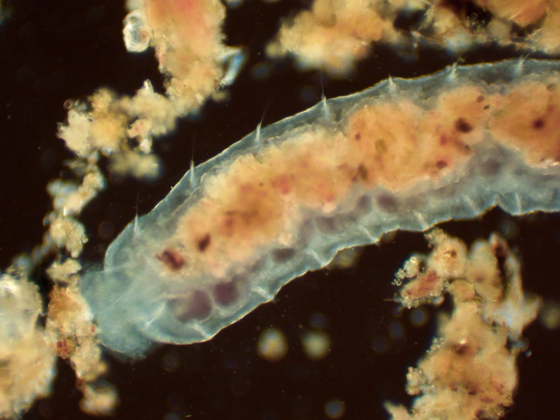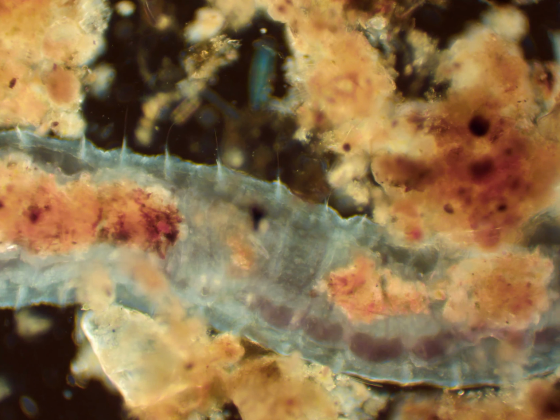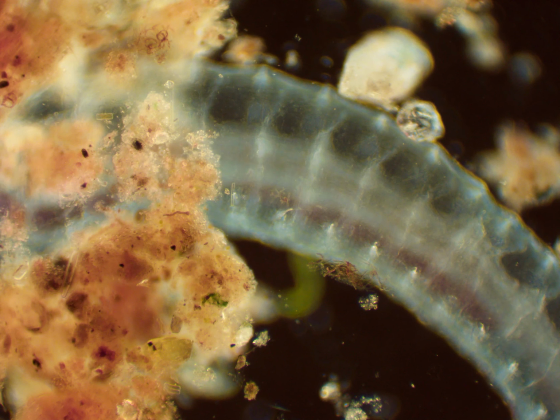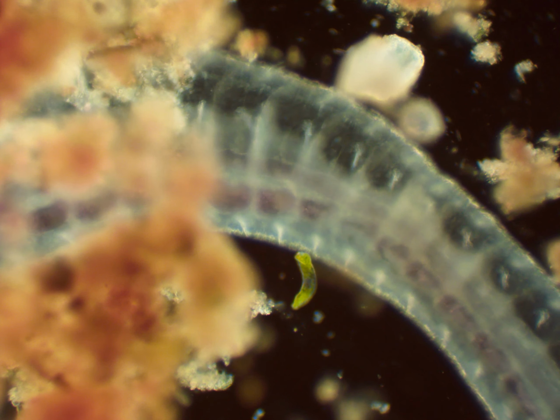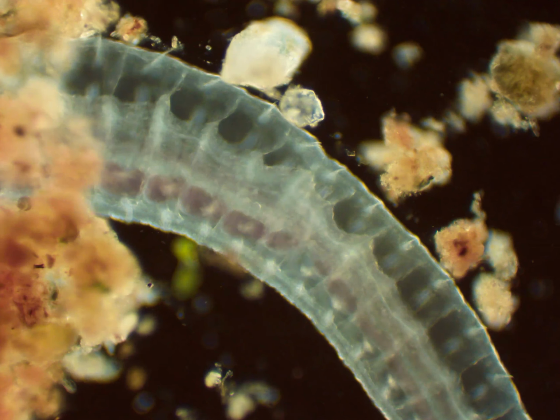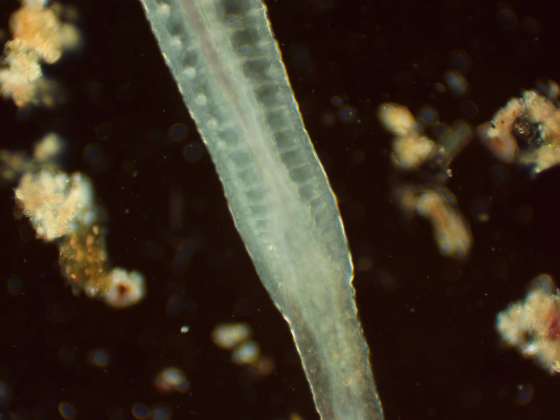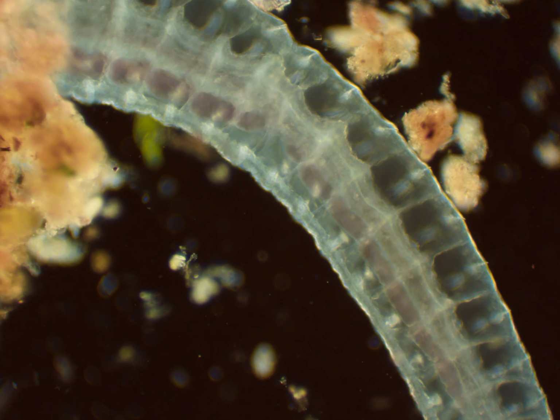You can see how it is going up and down the worm, and all of that inside of it is actually its food being pushed down by those muscles inside its digestive tract. You can see it being pushed along right there to the left of the screen. Look at the muscles contracting. It seems to go all the way around until a certain point, but here it is with the 40x objective.